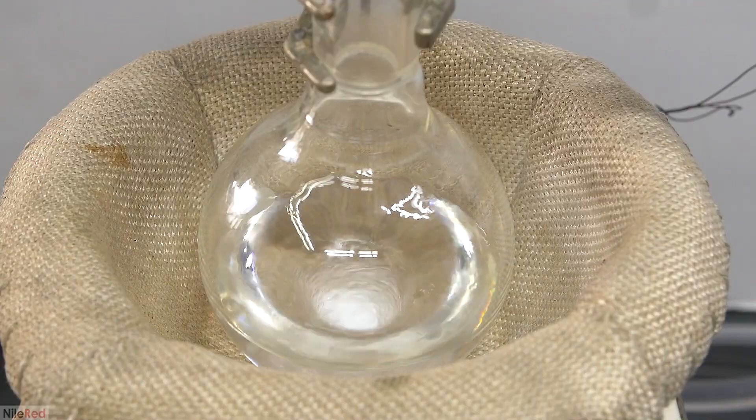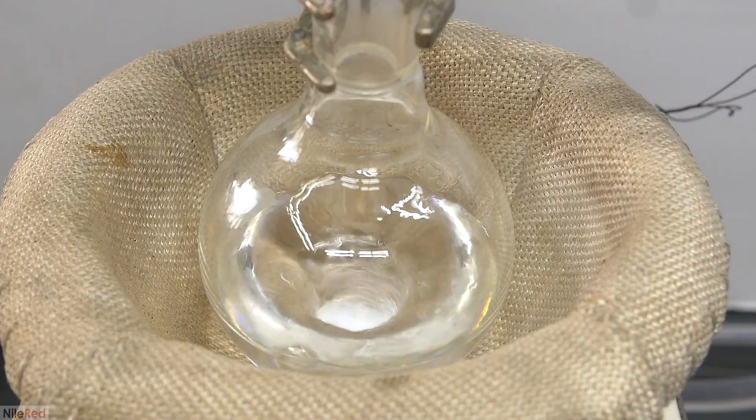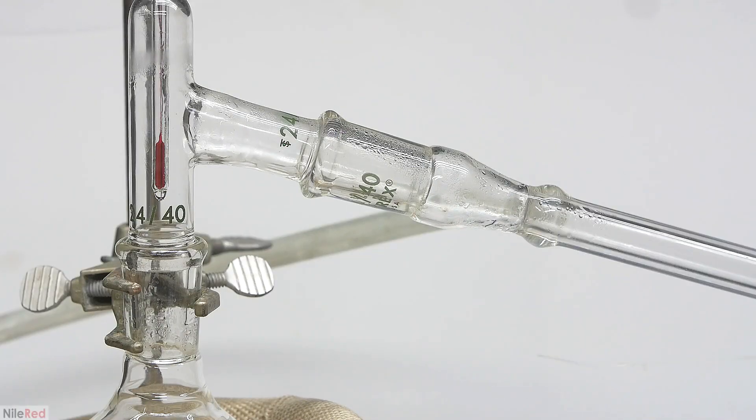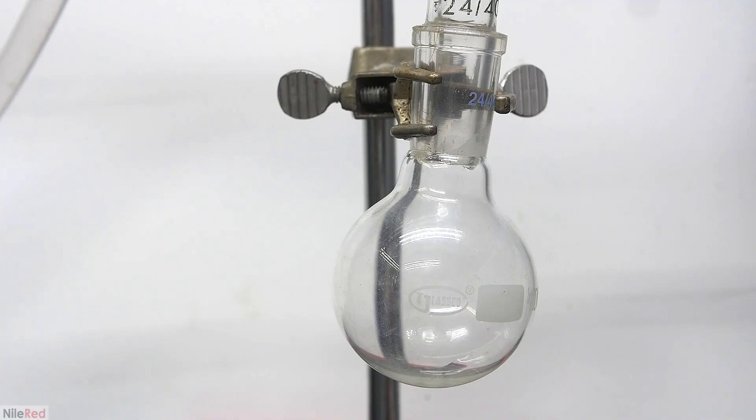Once the system is under maximum vacuum, I go ahead and turn on the heating. Not too long after, we start to get some distillate coming over. The stuff that came over initially wasn't actually benzaldehyde, and it was mostly just water.